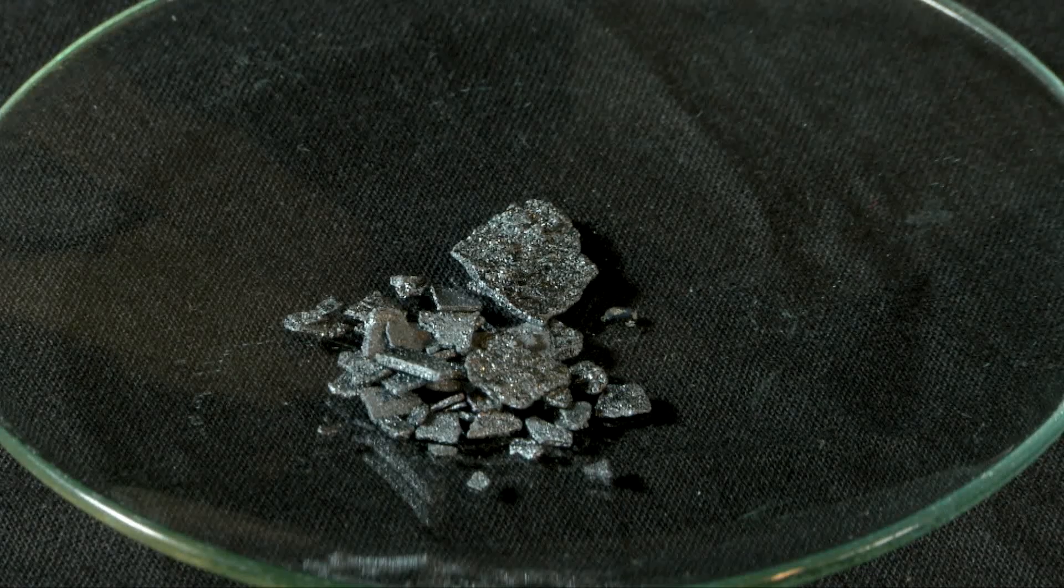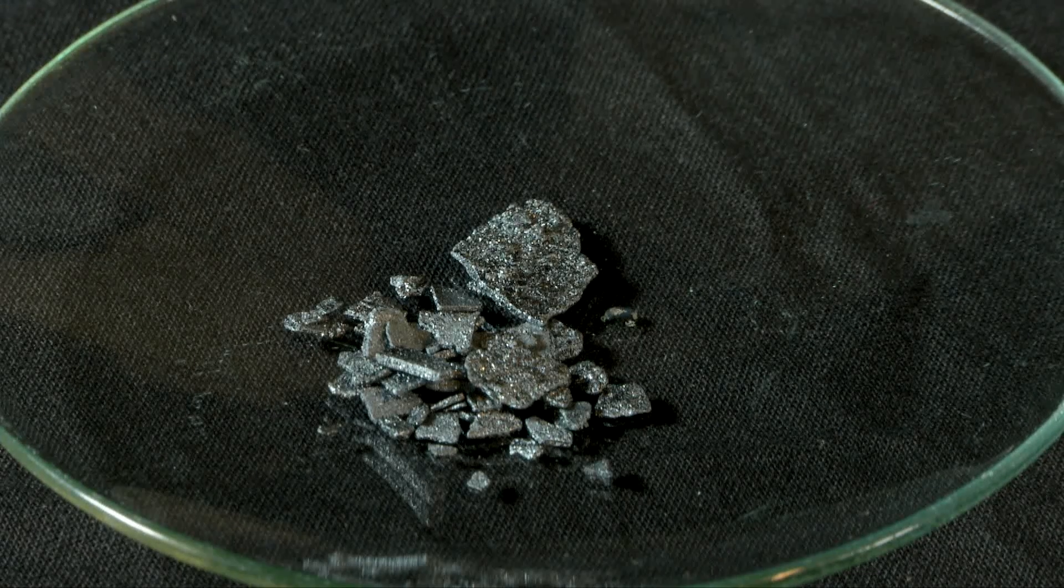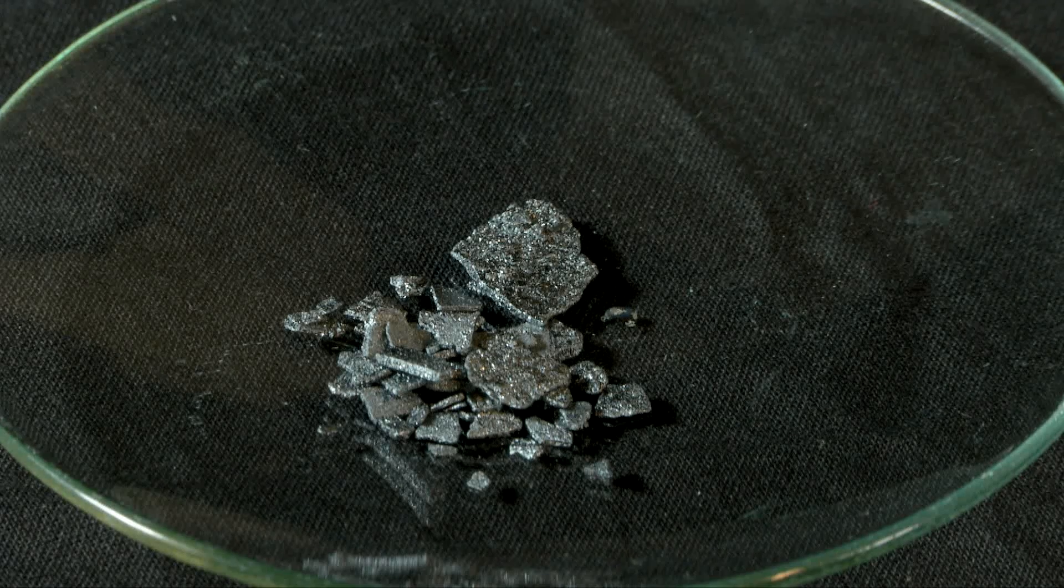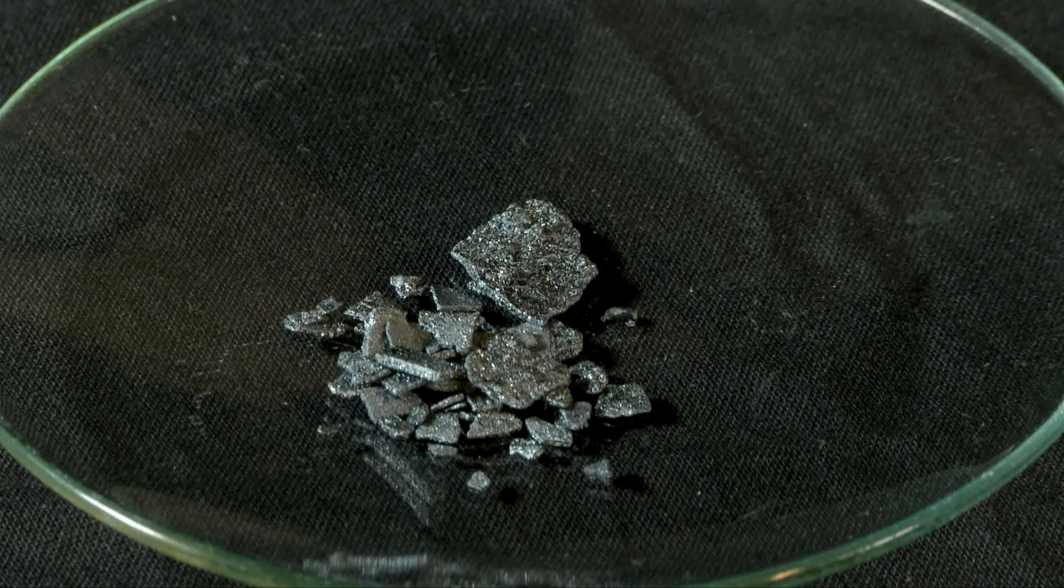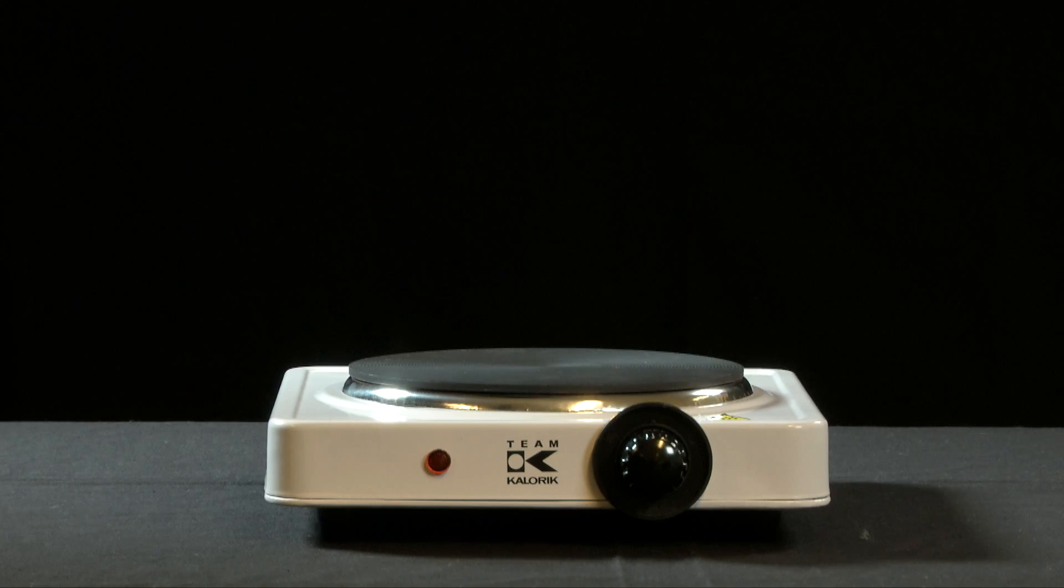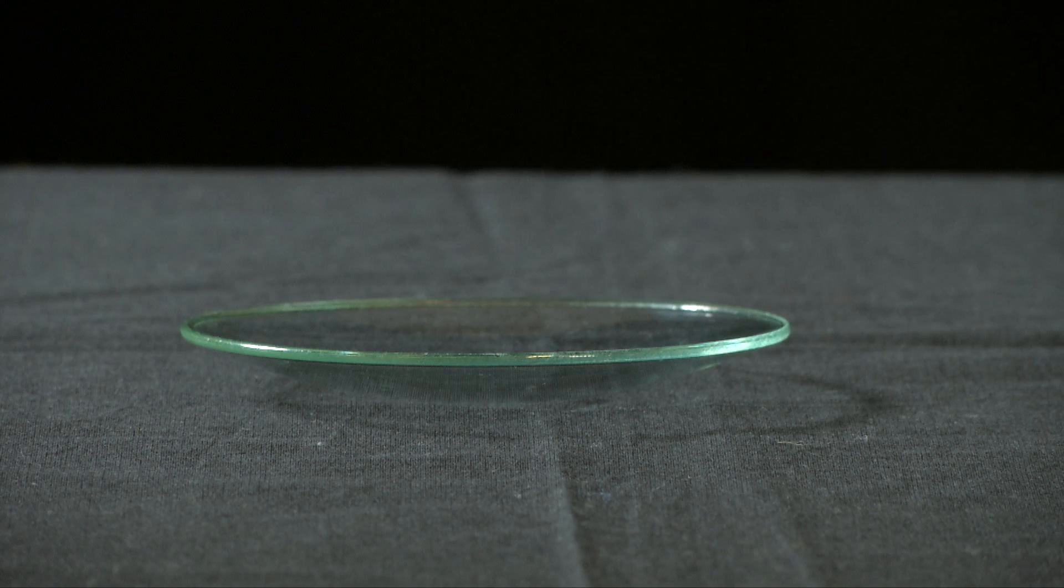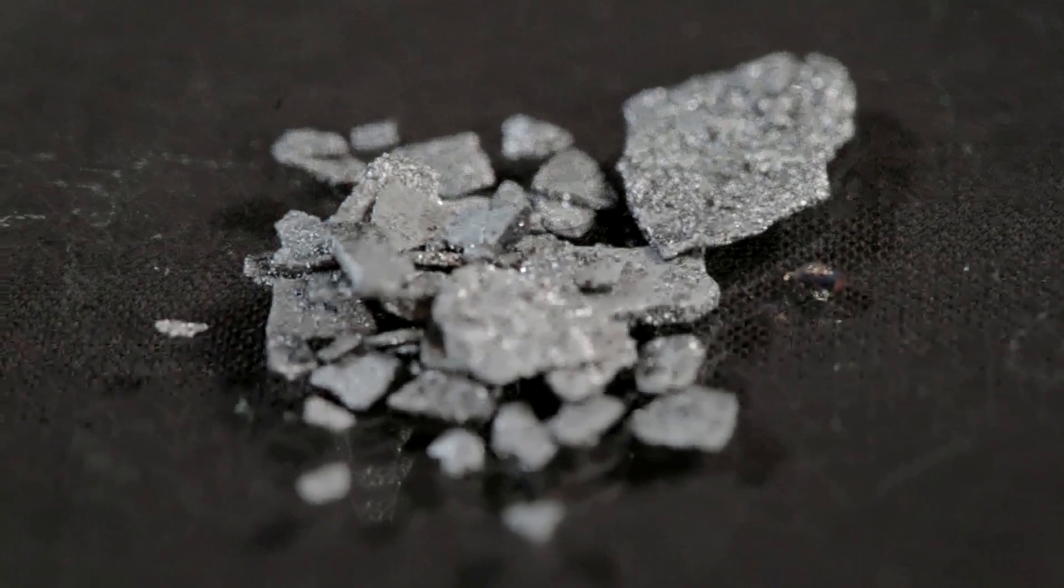Let's turn from theory to practice. We are going to turn solid iodine directly into gas and then reverse it back from gas to solid without the iodine ever being in a liquid state. We will use a heating plate, a beaker, a watch glass, ice cubes and some solid iodine.